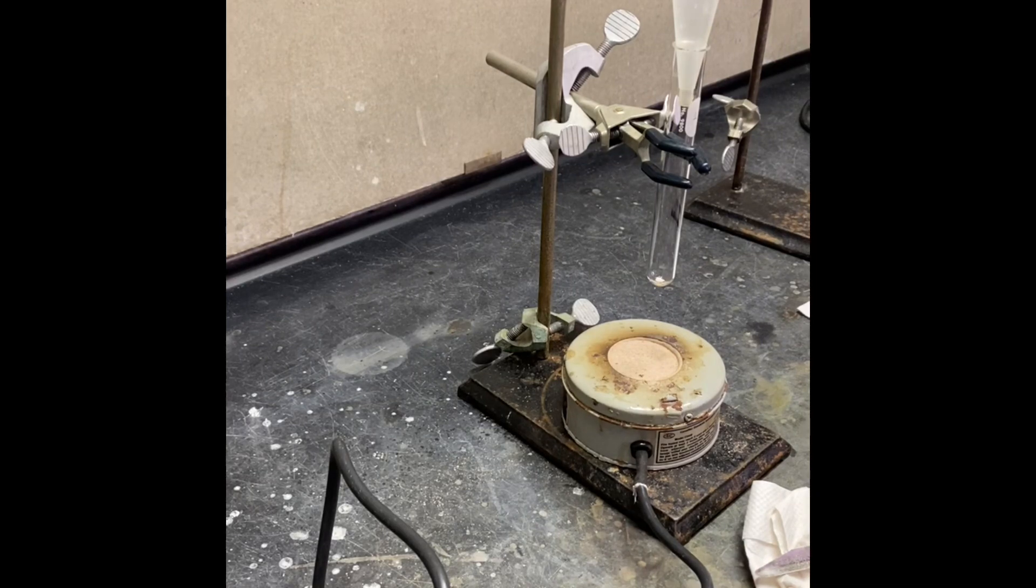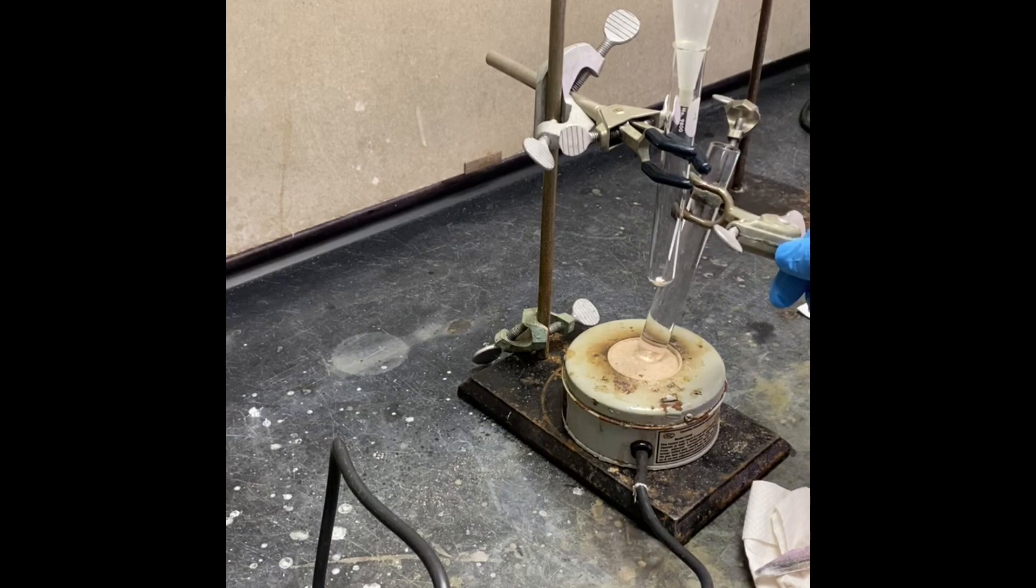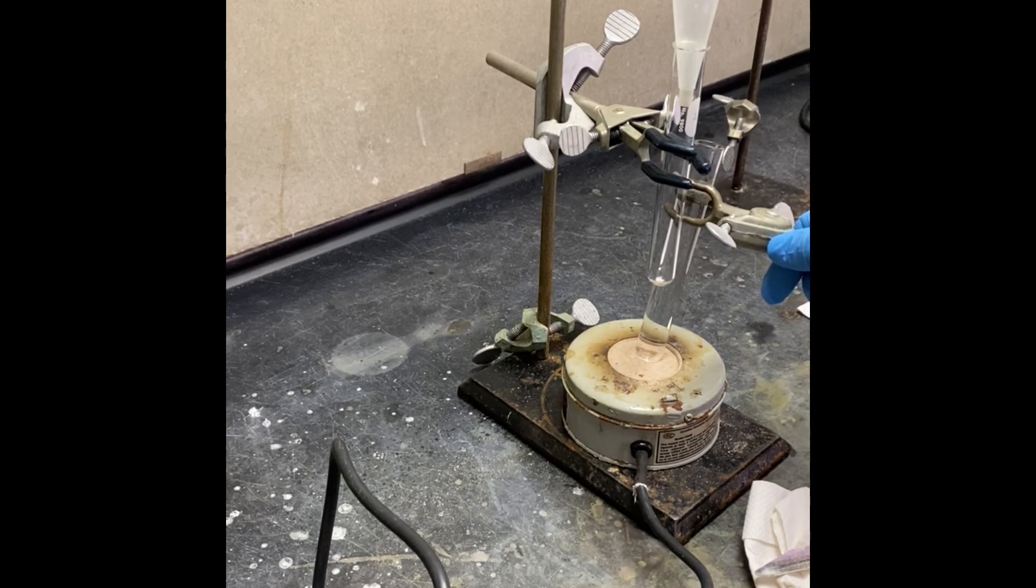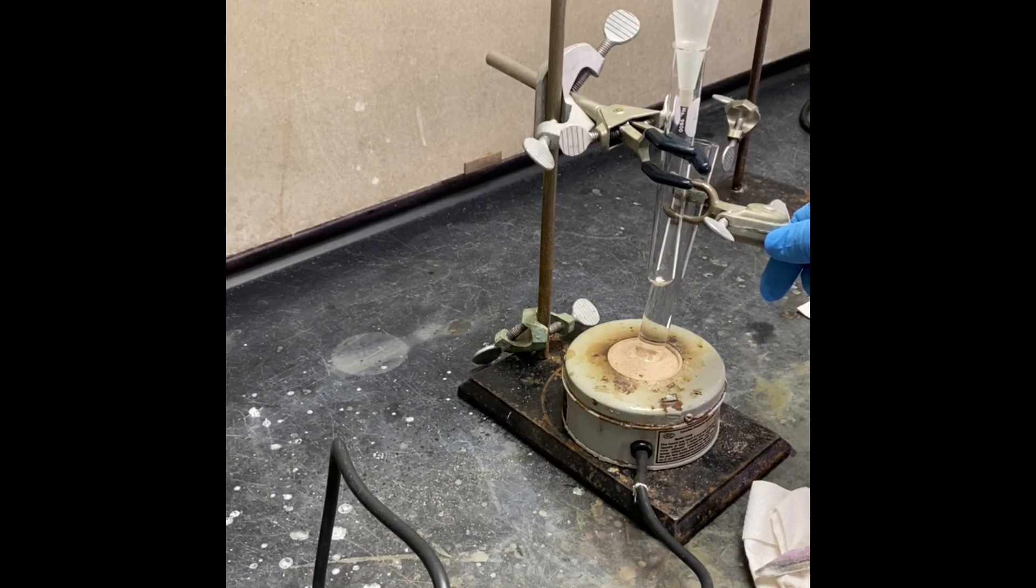We are going to synthesize luminol in this experiment. First, I want to heat up some water which I'm going to need when the first step is done for precipitation of my product, which is the nitro product.